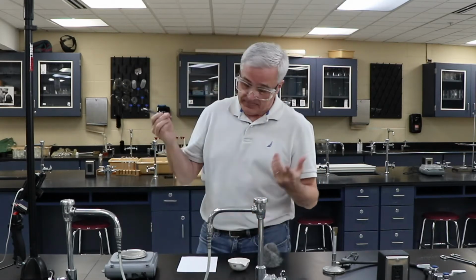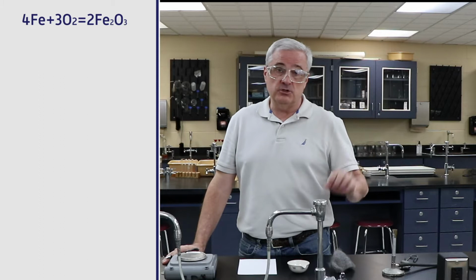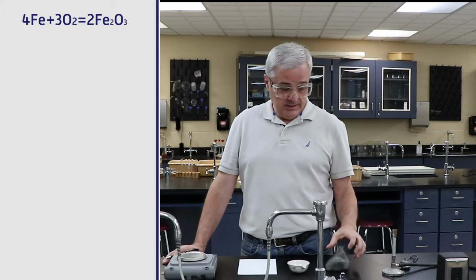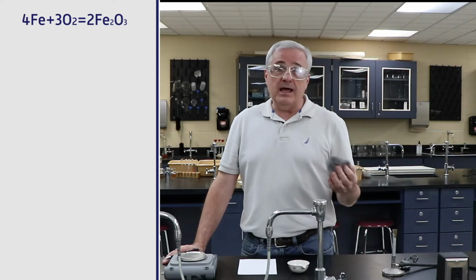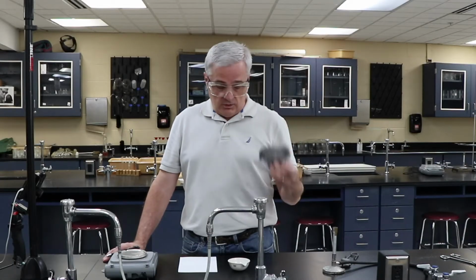I found it. What we have here is steel wool. Steel is iron and other stuff. It is an alloy. Oftentimes it is an alloy of iron and carbon. And then there's other alloys, all kinds of nickel alloys and things like that. I don't exactly know, I just got some steel wool, bought some. Didn't actually do chemical decomposition to figure out what it is. So it's steel wool. We're going to call it steel wool.